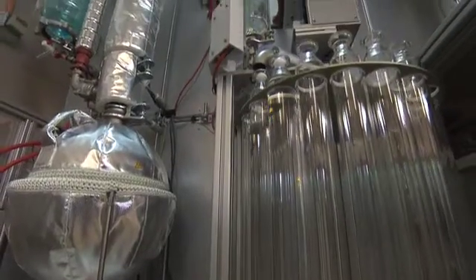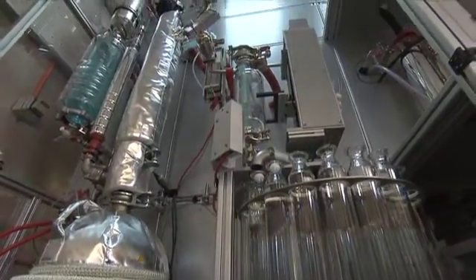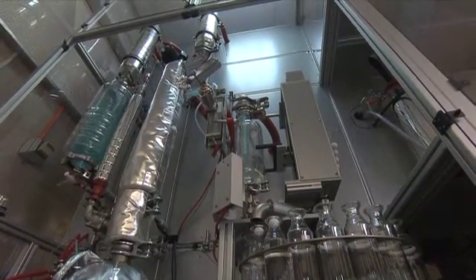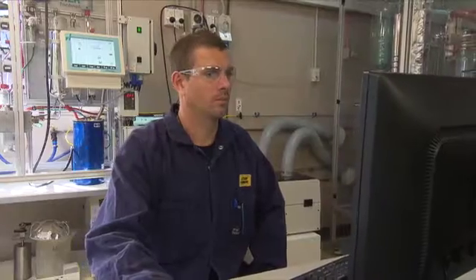Crude petroleum is a complex mixture of mainly hydrocarbons. Crude oil assay characterises this complex mixture by evaluating the boiling point distribution and the chemical properties of the different boiling point fractions. Crude oil assay provides data which gives information on the suitability of the crude for its end use, and also helps predict the commercial worth of the crude.